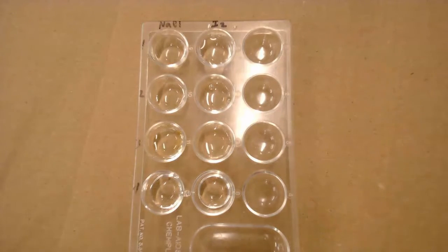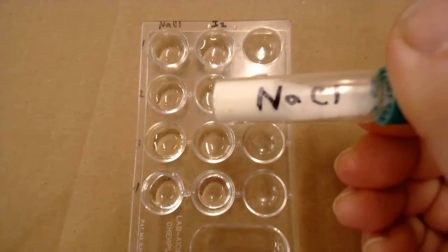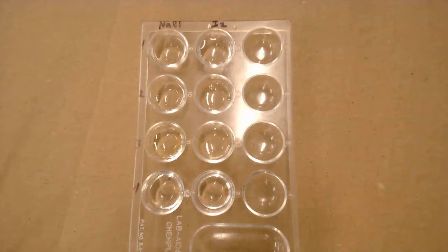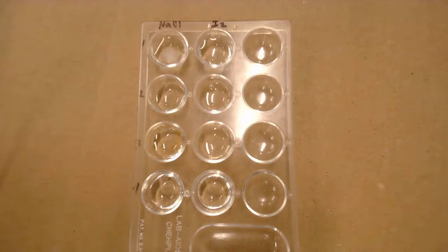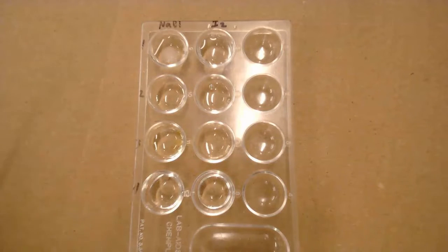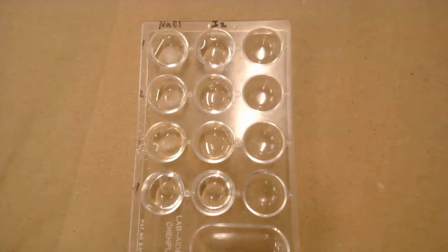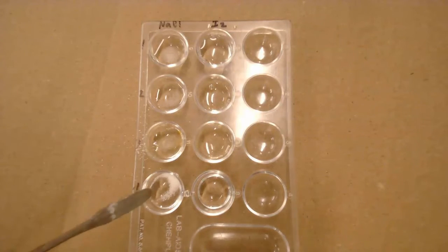To the first set of wells, we're going to put a small amount of sodium chloride. Sodium chloride — we know that's ionic, but it's going to act just like a polar substance, because just like a polar substance, it has a positive end, which would be the sodium, and a negative end, which would be the chlorine. So I'm putting a little bit of sodium chloride into each one of the liquids, and then we're going to stir them up to see what happens.